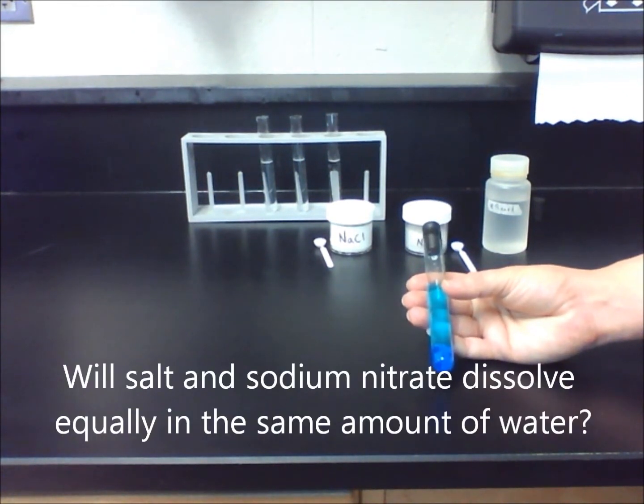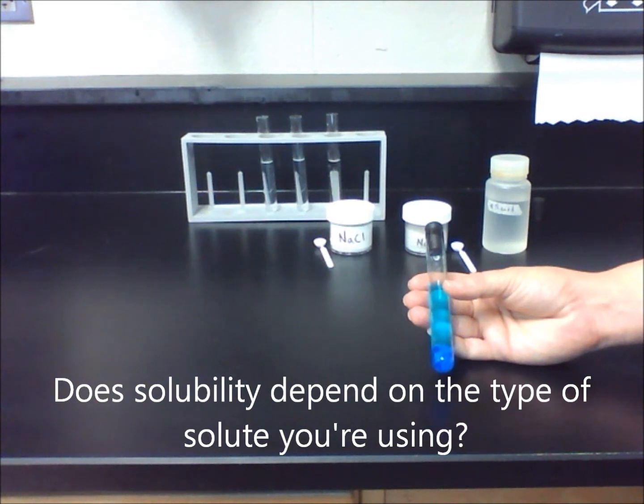In other words, will common salt and sodium nitrate dissolve equally if they are placed in the same amount of water? Does solubility depend on the type of solute? Students make and examine saturated solutions in order to answer these questions.